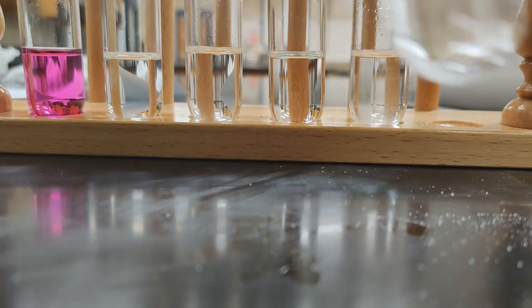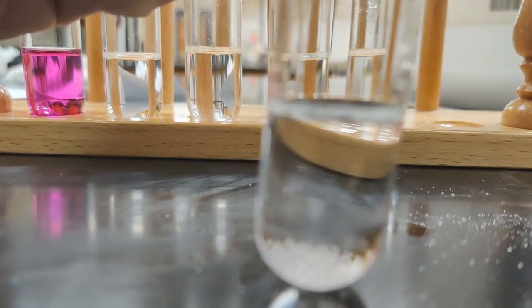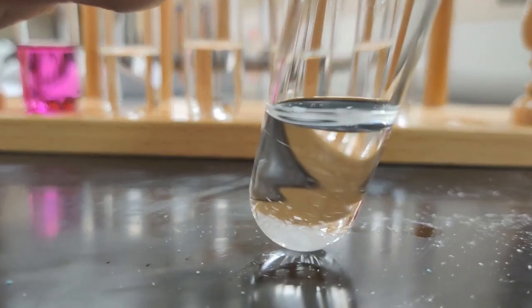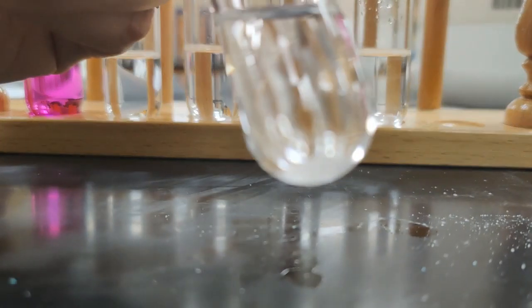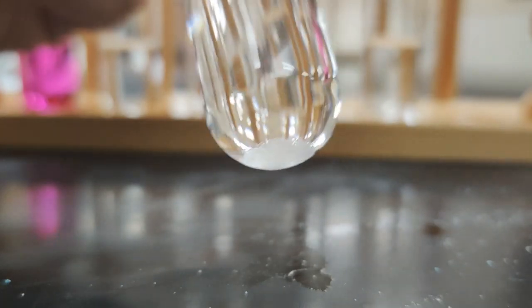Yeah, this almost doesn't even act like it wants to agitate in here. Look at all that. It's just sitting right there at the bottom. We can see that white at the bottom of the tube. Even if I agitate, it's kind of interesting in that it almost just acts like it doesn't even want to stir up with the water, or with the hexane.